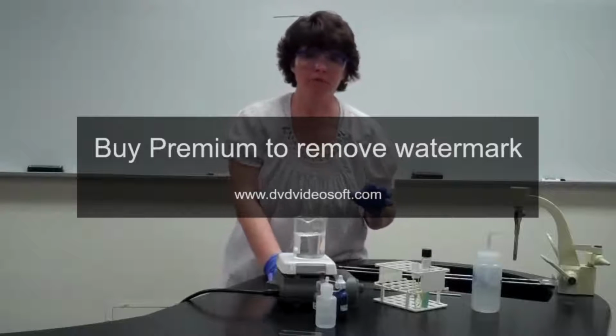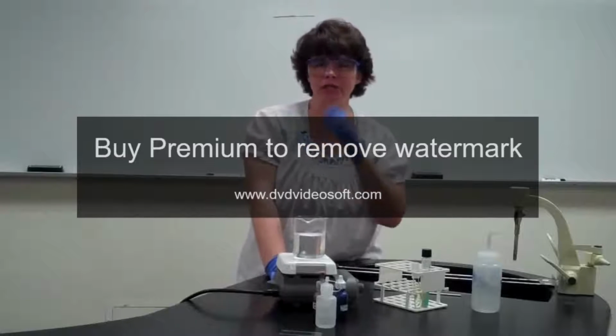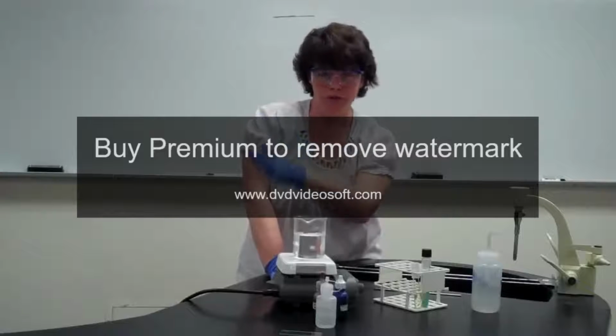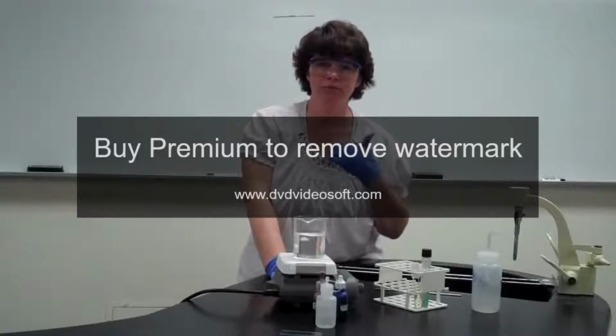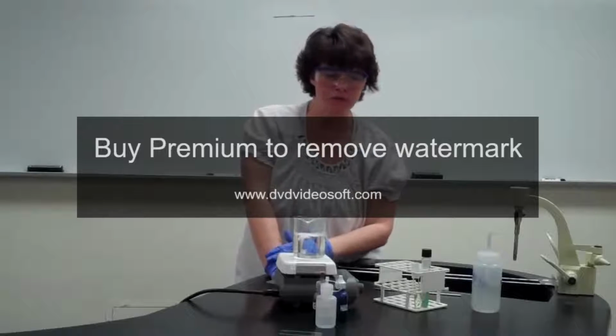One of the things that I want to point out about the lab that we're doing this week is that I am making some changes to what you're going to see in the lab manual. So we're going to do it out of the lab manual, but this video, I want you to note the changes because you're going to do it based on the changes that I tell you, but you're still going to be using your lab manual as a resource.